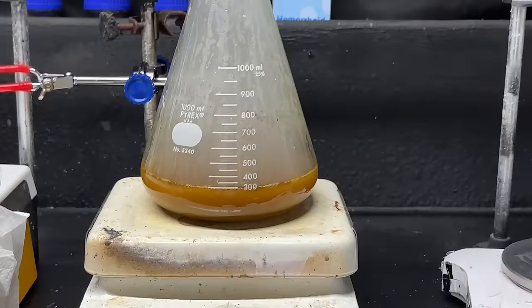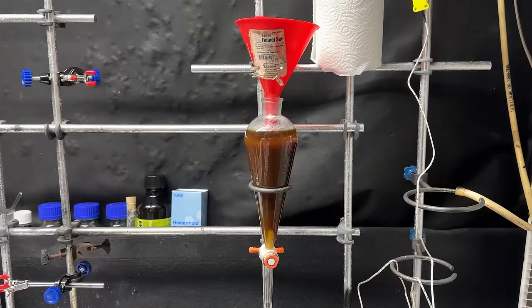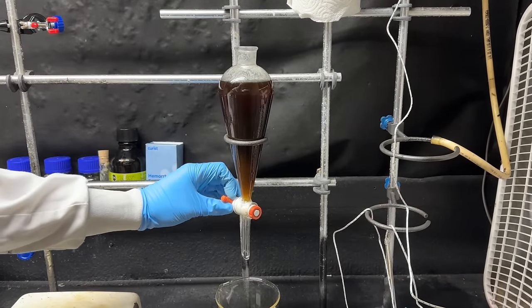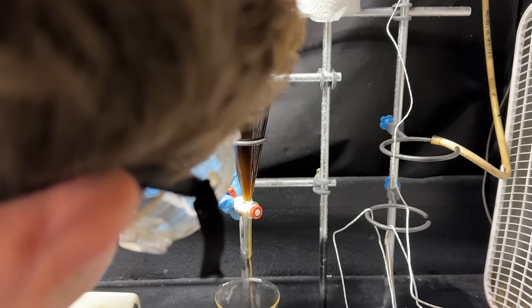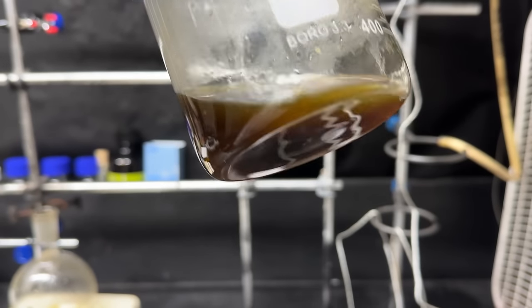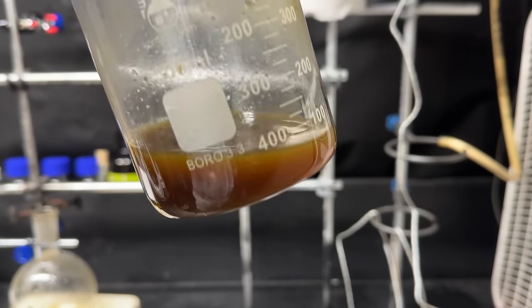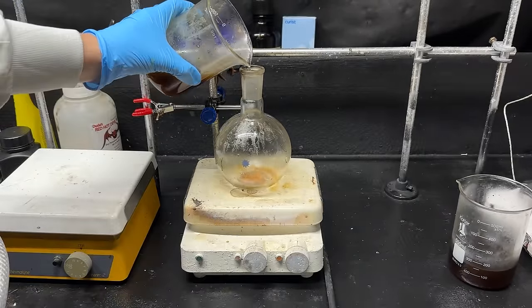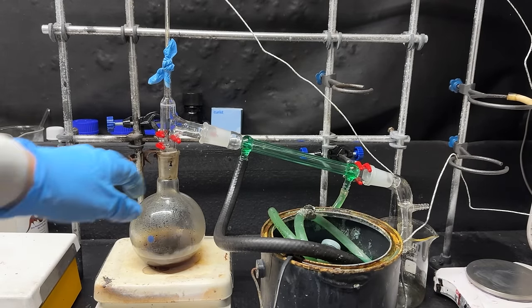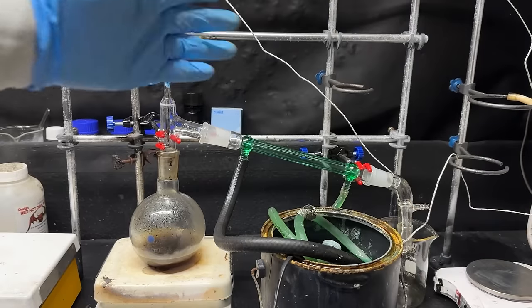Now I'm going to transfer the contents of this flask into our separatory funnel. It's really hard to tell but there are two layers, so I'm going to separate them — I think the bottom one is our aqueous layer. There's our bottom layer, which definitely looks like the aqueous layer. In this beaker should now be water and our histamine dihydrochloride — the essence of allergies. I'm going to pour that into a flask and distill the solution. It's not strictly necessary since it's just water and HCl, but I don't want to gas the place, so I'll do a little distillation.